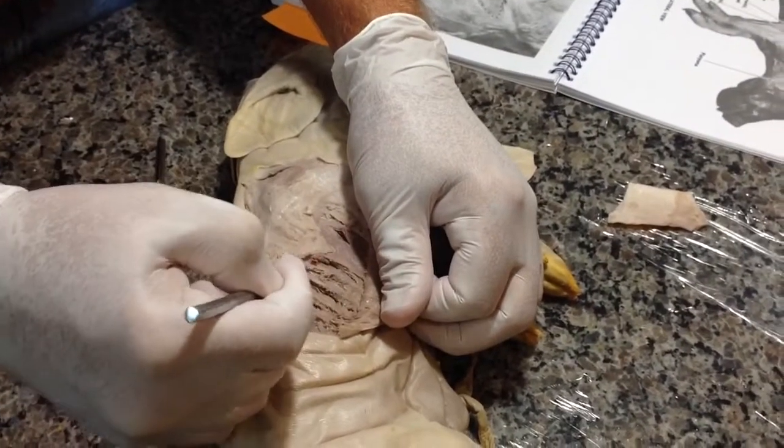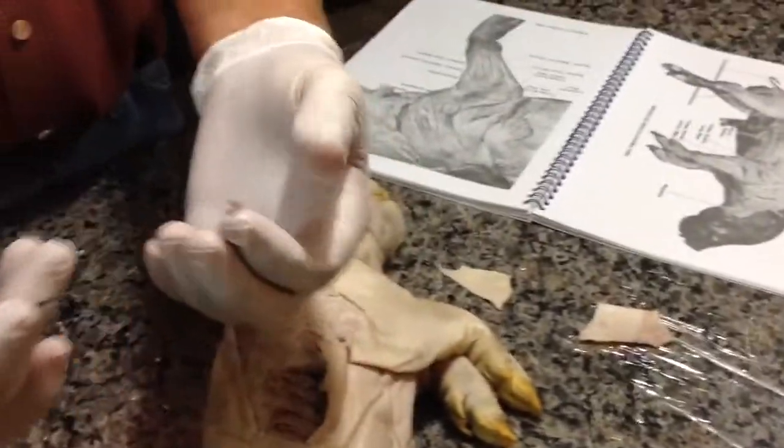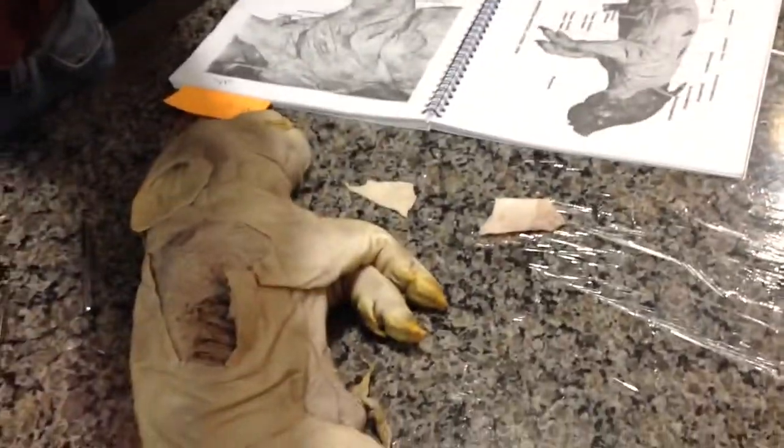That must make you hungry. I'm scraping across the rib cage right now, and I'm getting all these fibers. As we can see, all those fibers sticking up there, I'm giving you a moving target, aren't I, Shay?